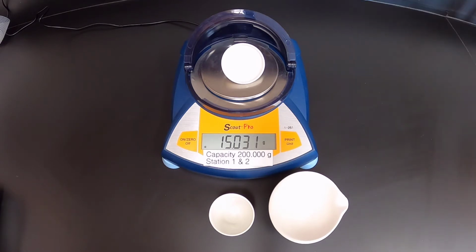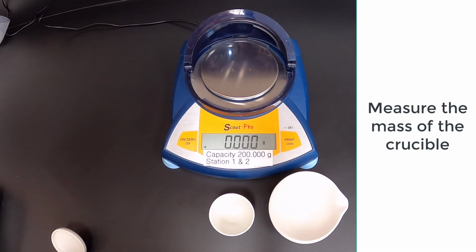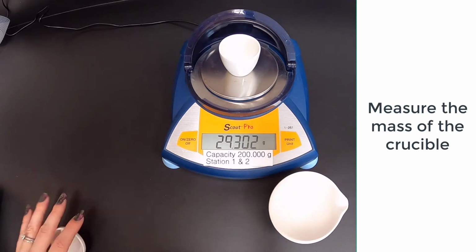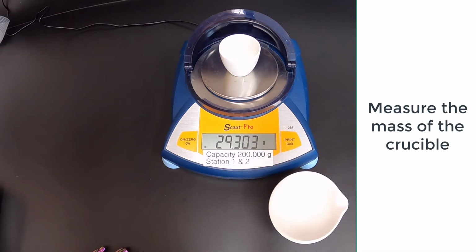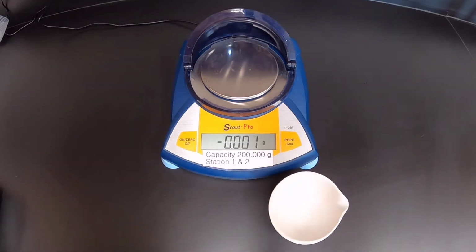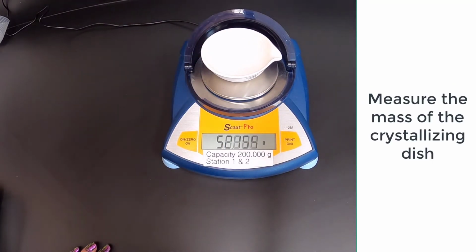Record the mass. Measure the mass of the crucible. Record the mass. Measure the mass of the crystallizing dish. Record the mass.